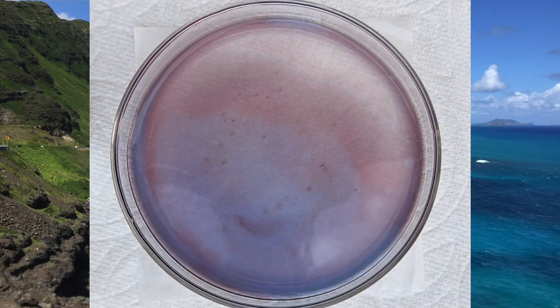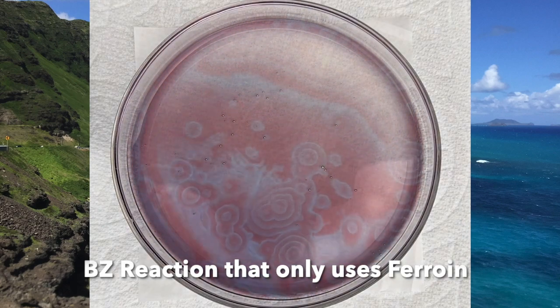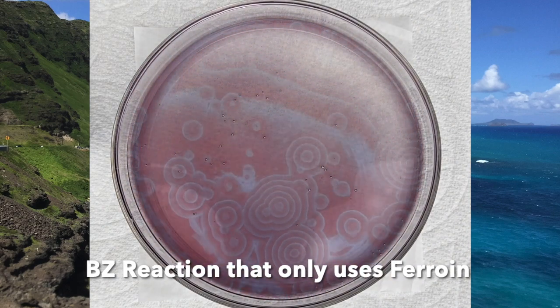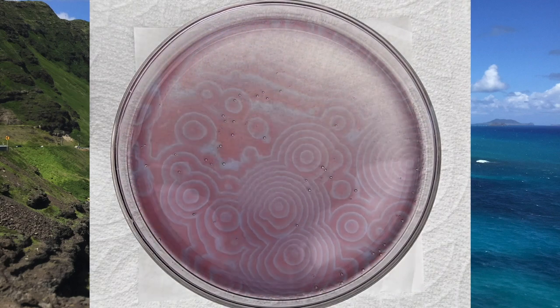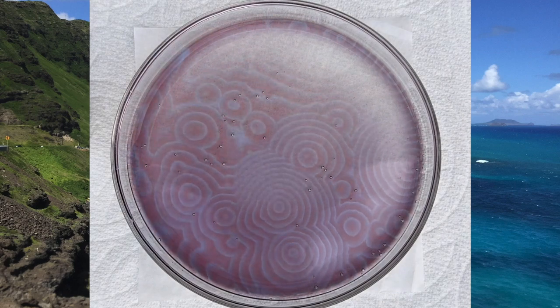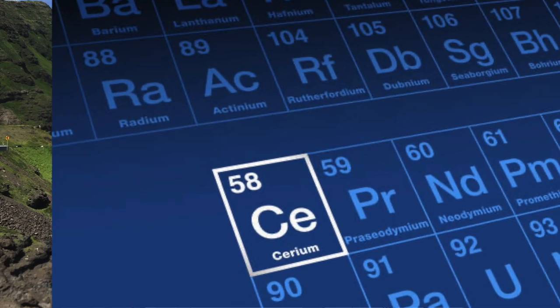In the previous episode, we delved into the renowned BZ reaction and explored a variation that employs ferroin exclusively as the catalyst. Today, we embark on a journey to uncover another, less prevalent variation that utilizes cerium as the catalyst. We will compare the outcomes obtained with and without cerium in this reaction.